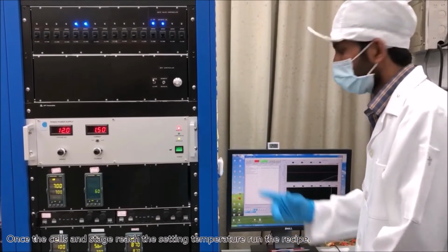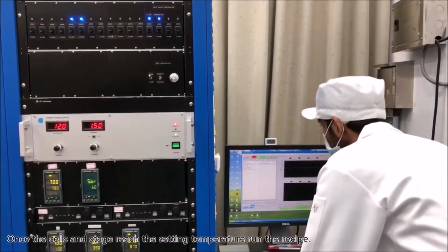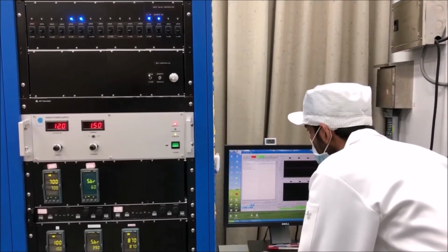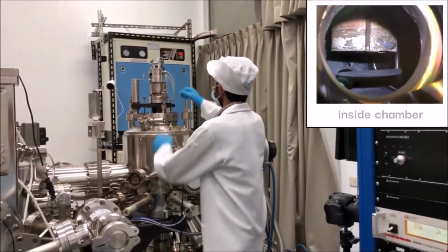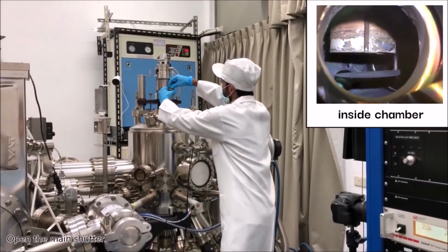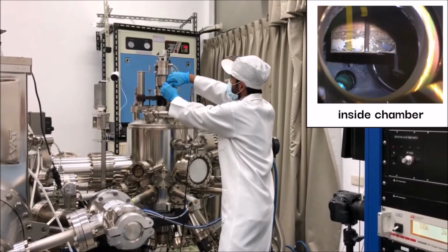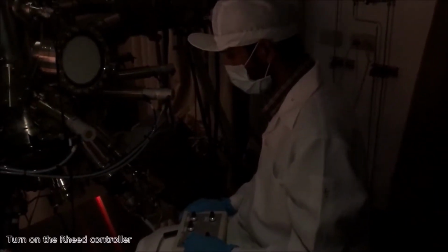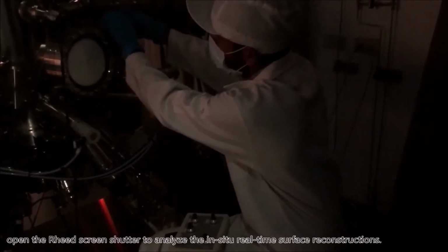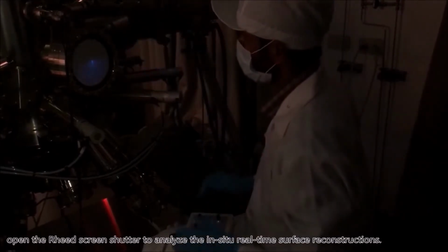Once the cells and stage reach the setting temperature, run the recipe. Open the main shutter. Turn on the RHEED controller and open the RHEED screen shutter to analyze the in situ real-time surface reconstructions.